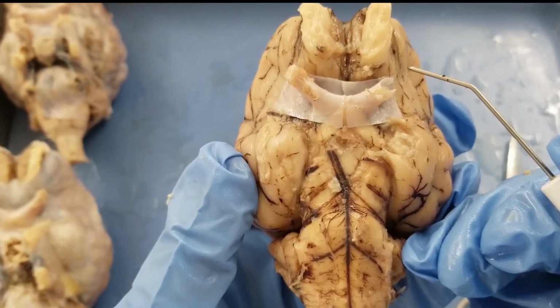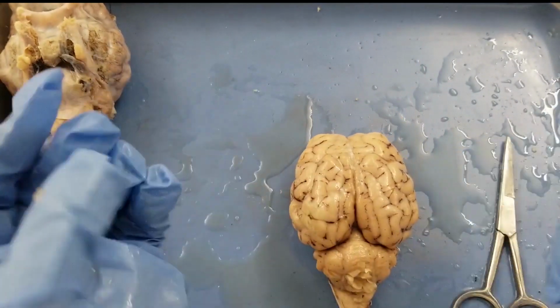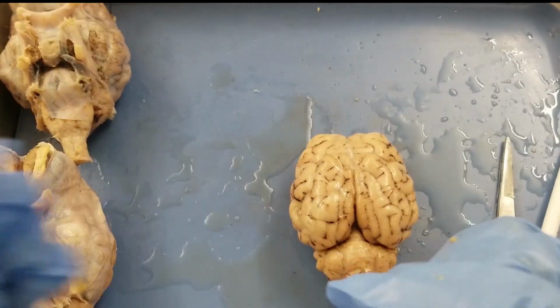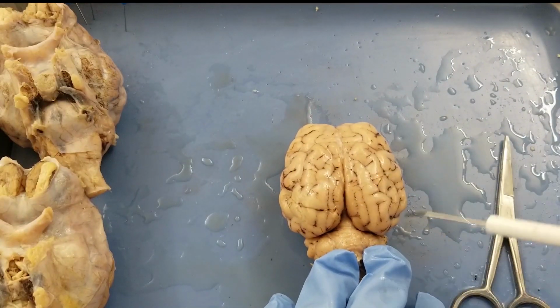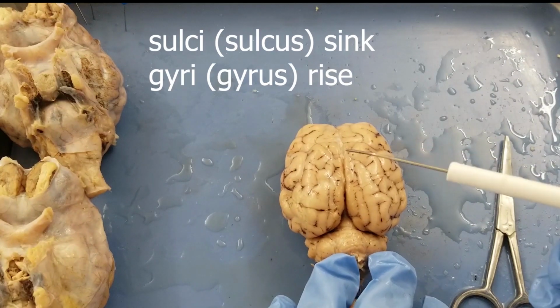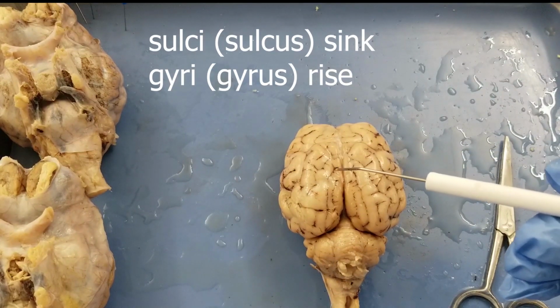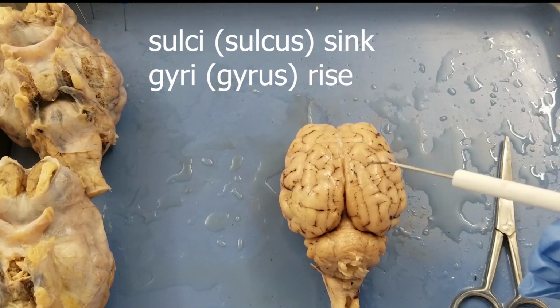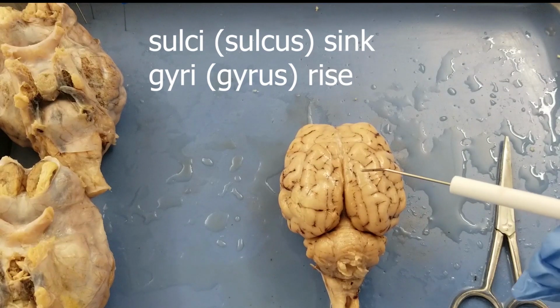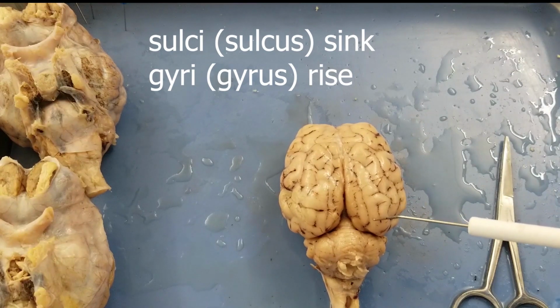Okay, now we need to identify structures on the dorsal side of the brain. So I'm going to lay the brain on its belly. First one, cerebrum. The cerebrum has two hemispheres. And then the sulci and gyri. Sulci is the plural form of sulcus, right? So see this darker colored thing here? That is sulci. And then the gyri, right? So this is a gyrus, and the plural is gyri.